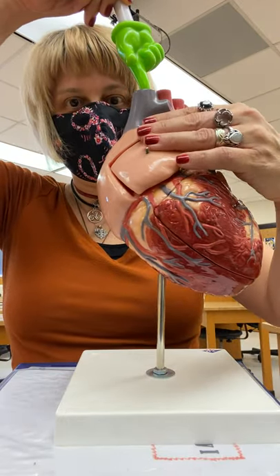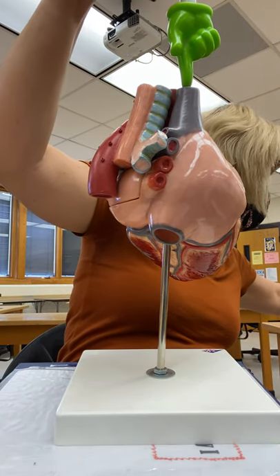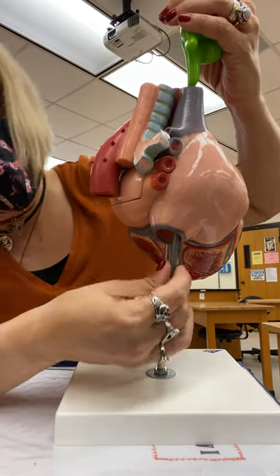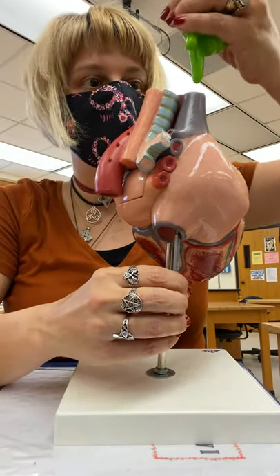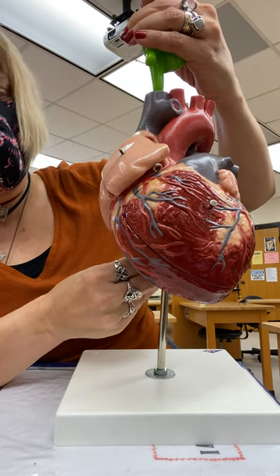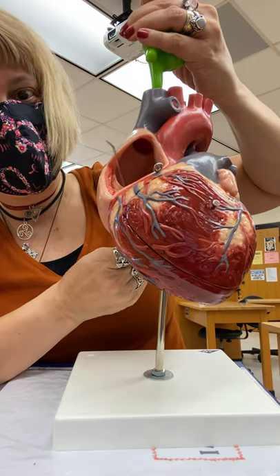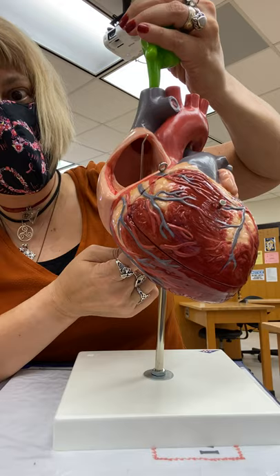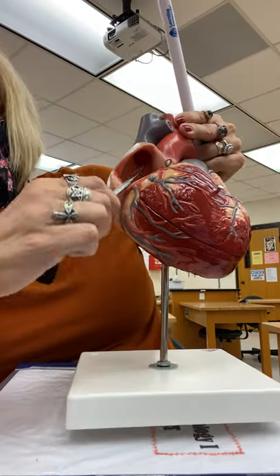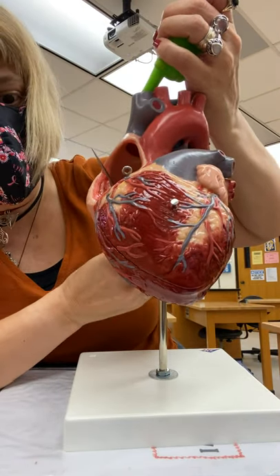I'm turning it around. Here is the inferior vena cava right here. So: superior vena cava, inferior vena cava. Now if I open this up — boom — we're in that right atrium. If this went through, it would go straight up in here — that's your superior vena cava and inferior vena cava entering the right atrium.